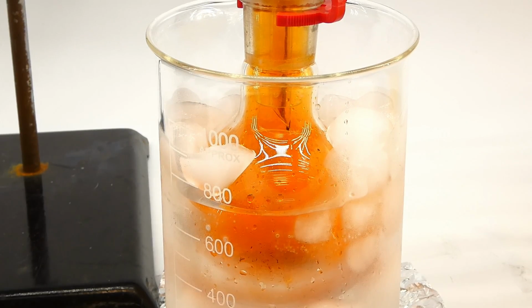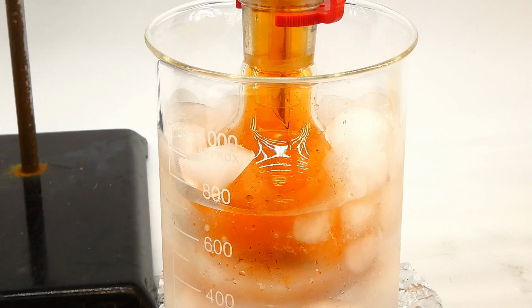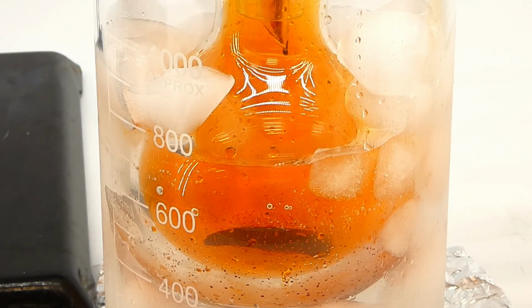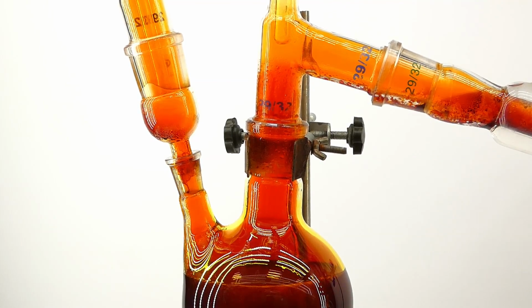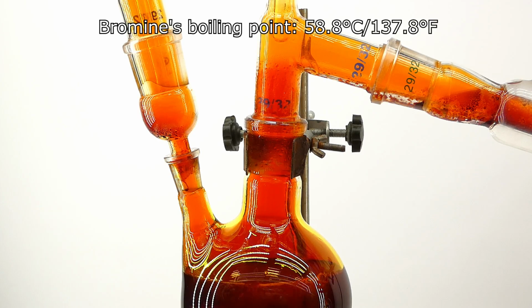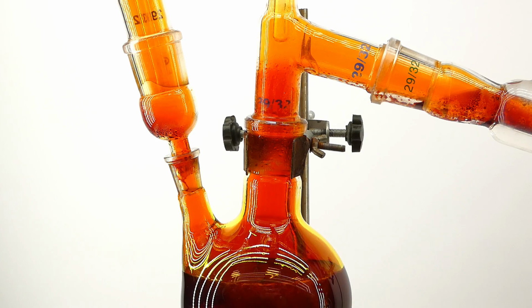After some time, a lot of bromine started coming over into the receiving flask, which looked really nice, and I stared at it for way too long. I continued this sulfuric acid addition, and just the heat from the reaction alone was enough to make all the bromine vaporize, which is good because I didn't need to use any external heating.